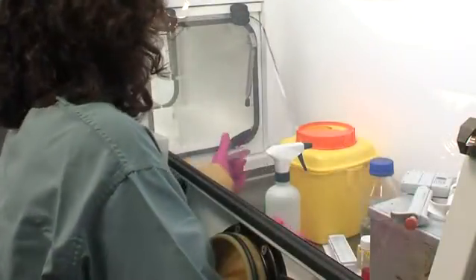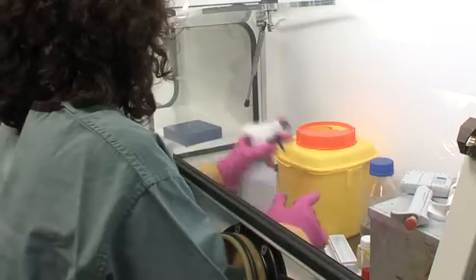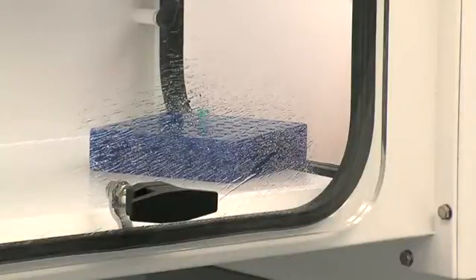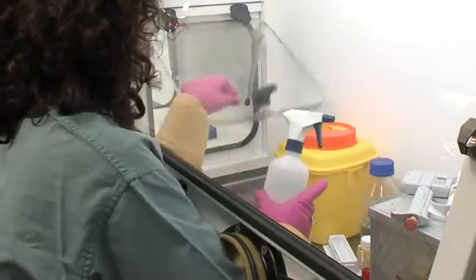Once the cabinet is in use, all materials you are going to need must enter and exit the cabinet via the pass hatch following the appropriate protocol. All materials that exit the cabinet must be surface decontaminated and placed in the pass hatch.